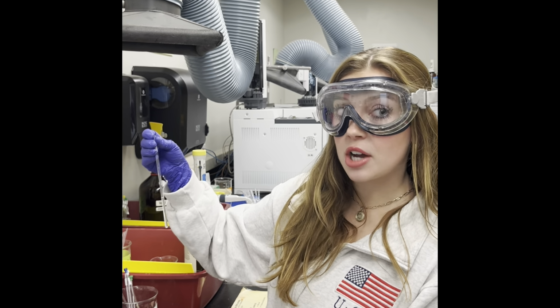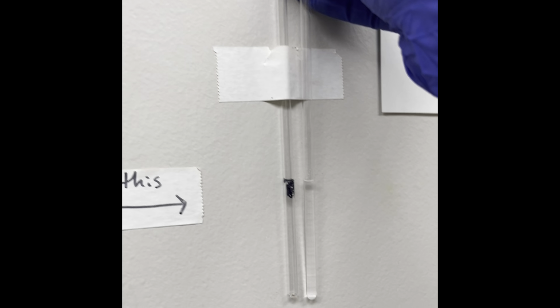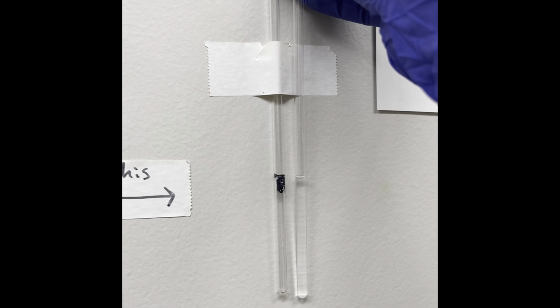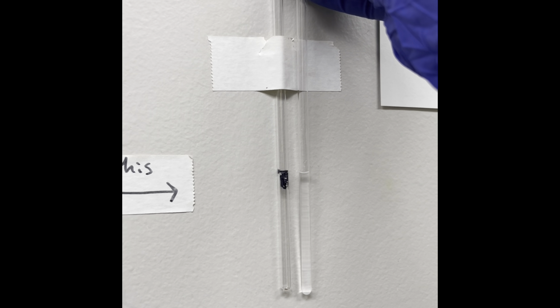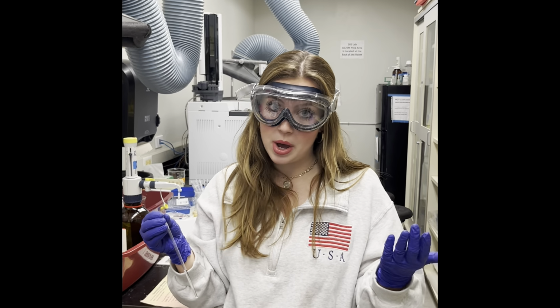You should definitely check with the reference NMR tube taped up here on the wall. The level of your solvent should match up with the black line on the wall. If your level is too short, you can always add just a little bit more solvent by lifting the top of the bottle and pushing down again. If your level is too high, however, you should probably just start over with a new NMR tube.